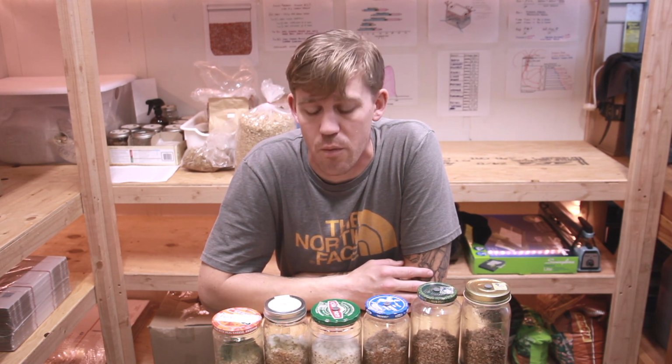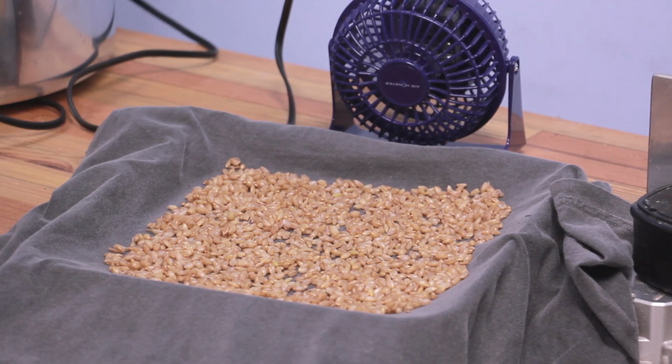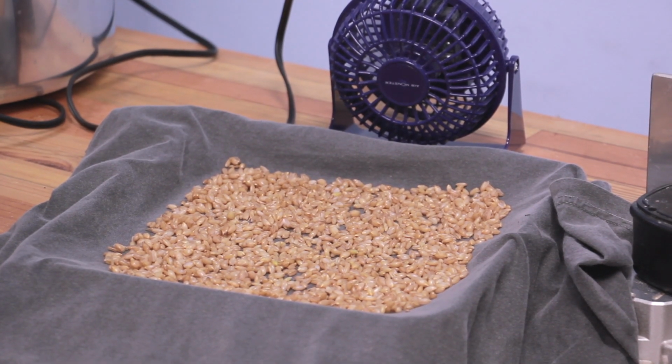So I tried to dry the grain more, which ended up resulting in spending a lot of time just in open air without all the low pH liquid around it, and it allowed quite a bit of other bacteria to get into it. So I might need to figure out a better process for drying. Honestly, if I threw it in the oven for a little bit to dry it, I think that might work better. But yeah, we'll see.